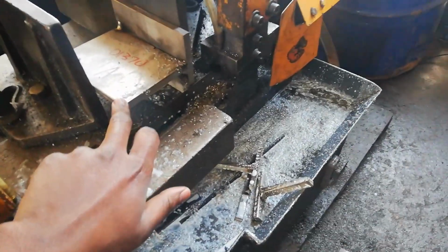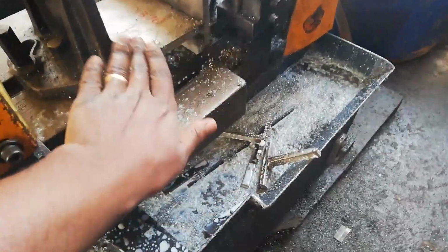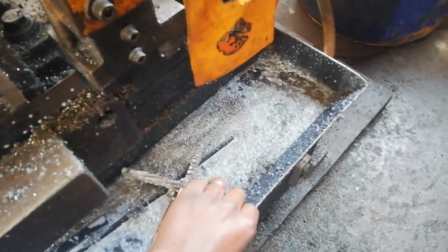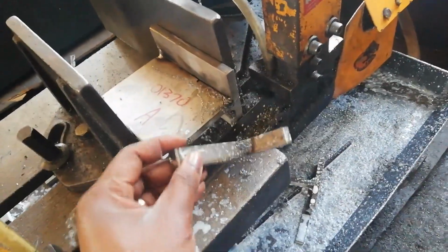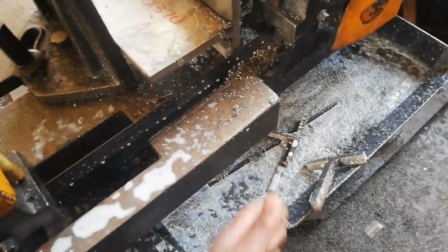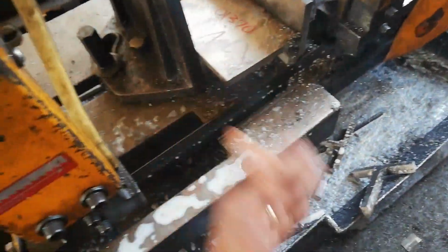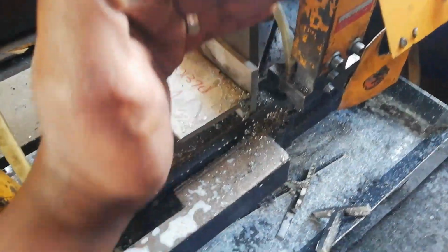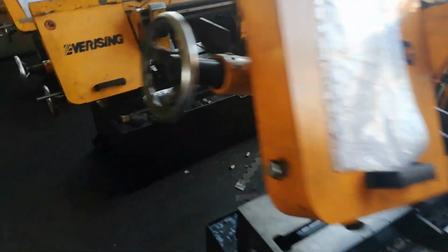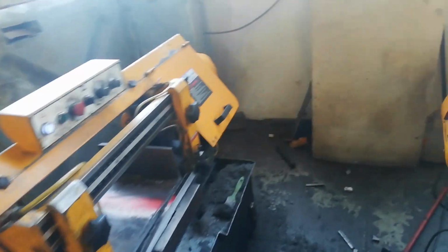This sample here is for fracture test or macro test, depending on the requirements or the standard code that is being used. As I told you about the part that's going to be discarded, this is an example of the part that will be discarded. You discard something like 20 to 25 millimeter out of the sample, and for the remaining part you cut either the macro and the fracture or macros only, depending on what the testing code is asking for.